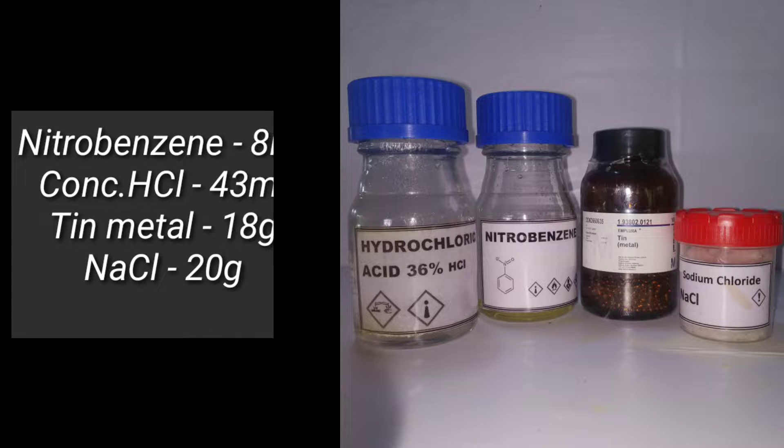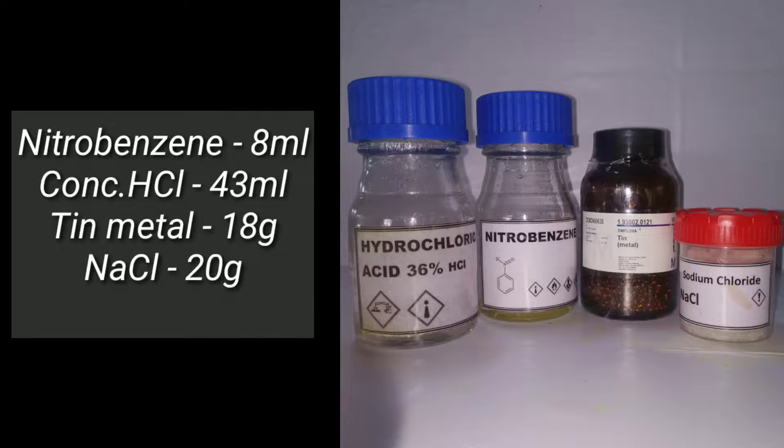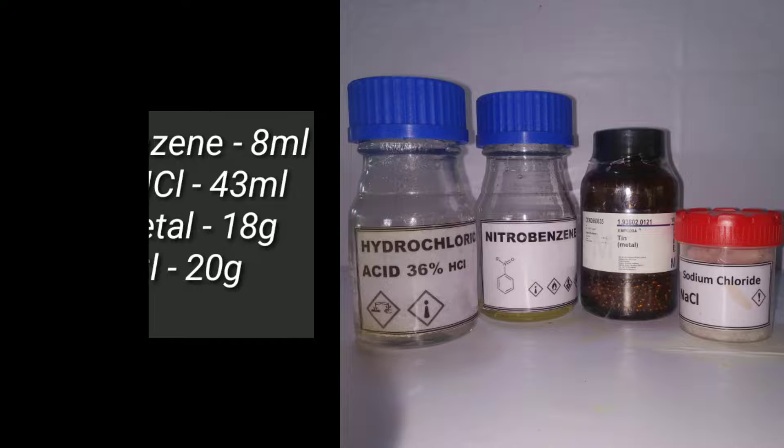The materials required for the synthesis include 8 ml nitrobenzene, 18 grams of tin metal granules, 43 ml of concentrated hydrochloric acid, and 20 grams of sodium chloride.